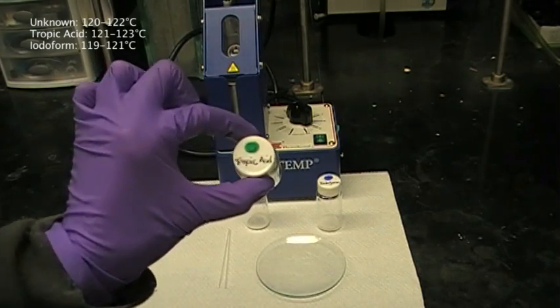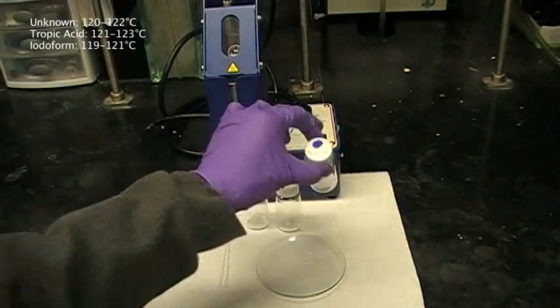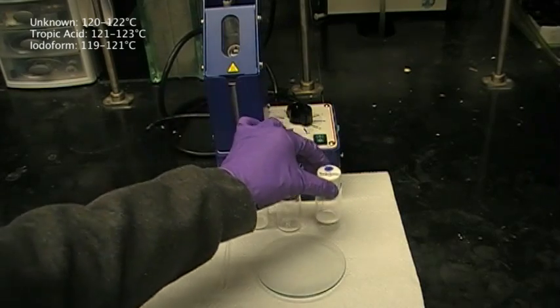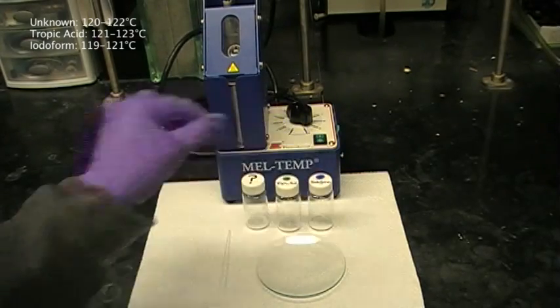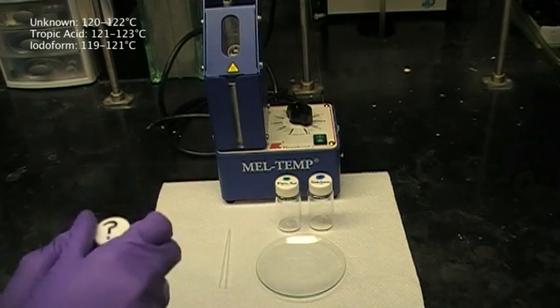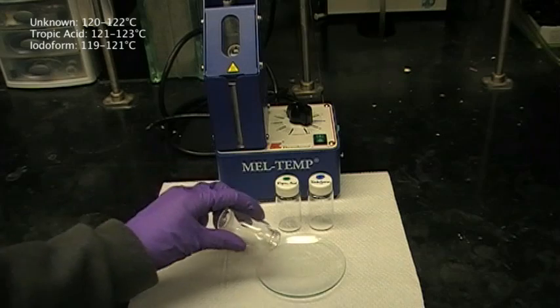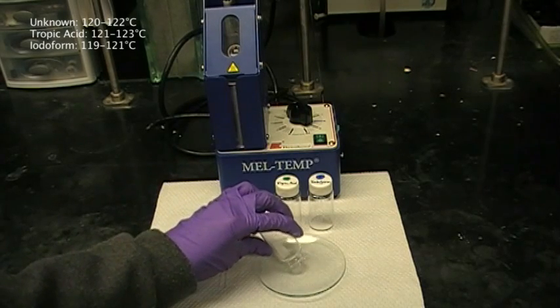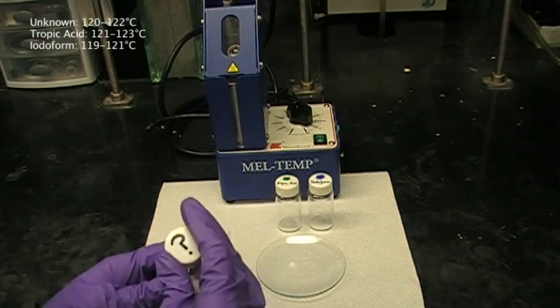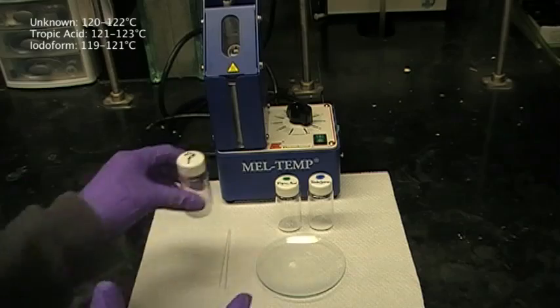Let's say we know that both tropic acid and iodoform also melt around 120 degrees Celsius. In order to figure out if the unknown is tropic acid or iodoform, we're going to have to take a mixed melting point. To begin, we first take a bit of the unknown and a bit of tropic acid and mix them together really well.